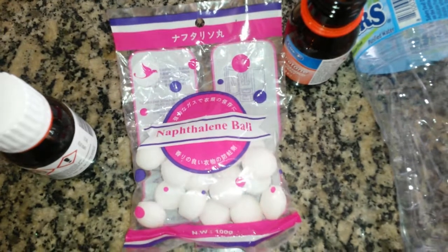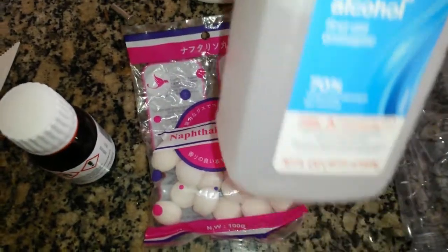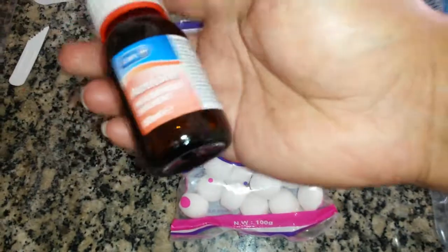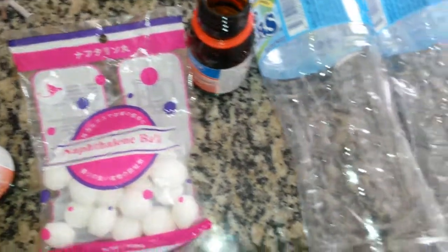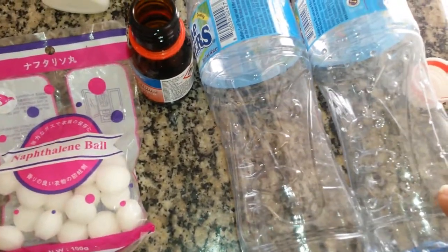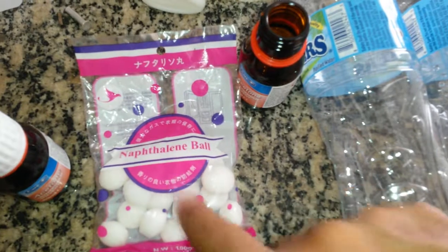This is a crazy experiment. I have extra isopropyl alcohol here, I have lots of it. Two or three days before I leave, I got some acetone — an old bottle of acetone that was already trying to remove oil. I have two bottles: I'll pour some isopropyl in one, some water in the other, and acetone in this one. I'm going to see if these balls dissolve.